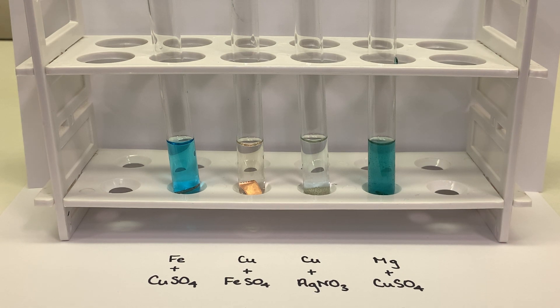Okay, now that you've made your observations after 15 minutes, I'm going to speed up the video again for another 15 minutes, and then we'll make our final observations after 30 total minutes of reacting.